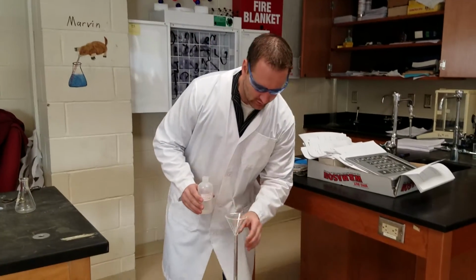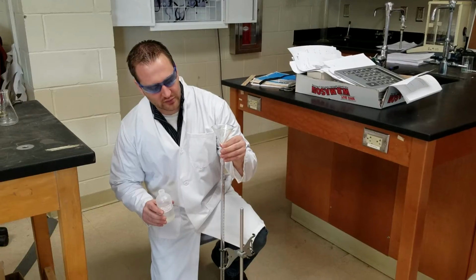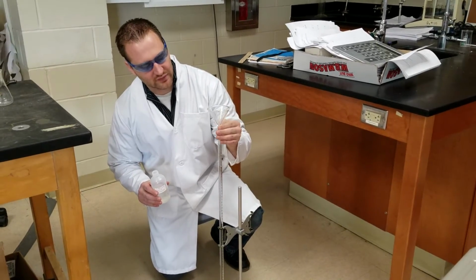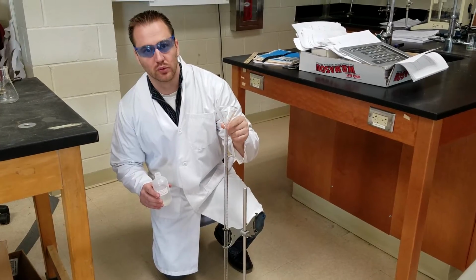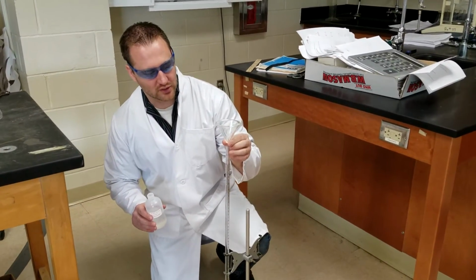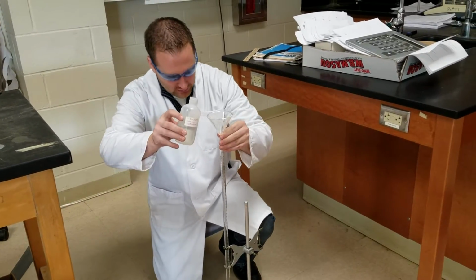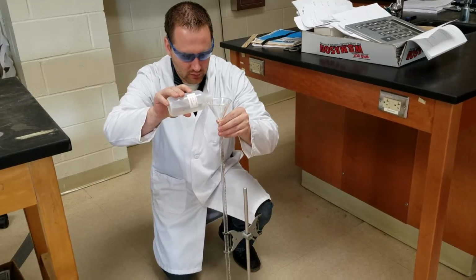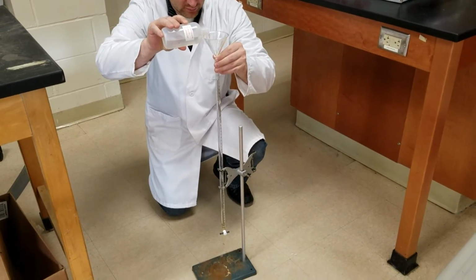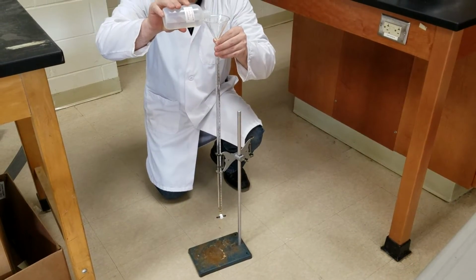Alright, so stopcock is closed. I'm going to hold this funnel just slightly above the edge. If it sits like this, what can happen is you get a buildup of pressure, and then the base will pool in the funnel, which can lead to it overflowing and making a mess. So I'm going to hold it there just so the air can vent and pressure does not build up. I'm only going to fill this thing up part way, but it's important that you do not overflow.